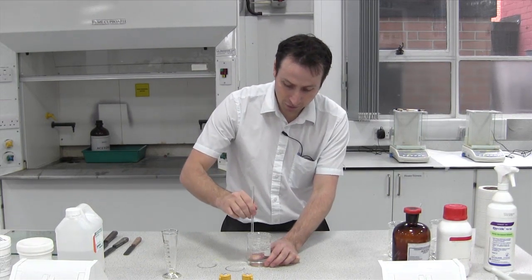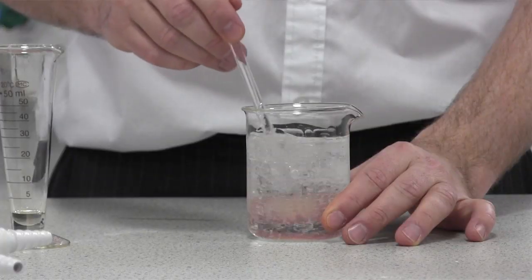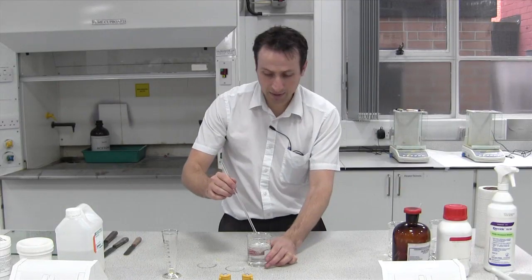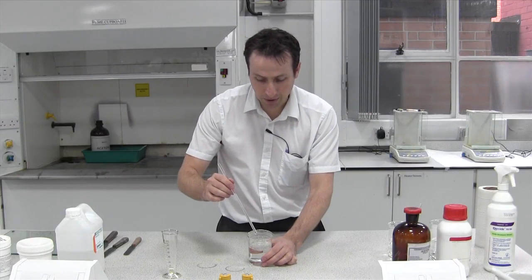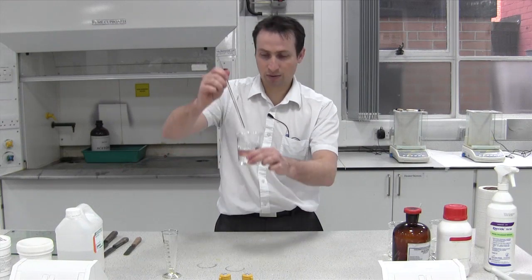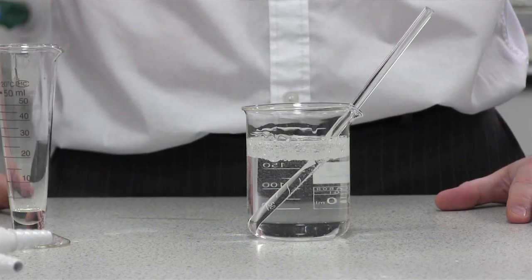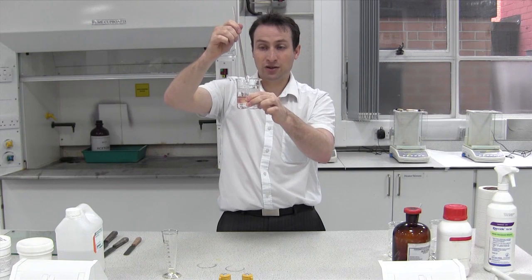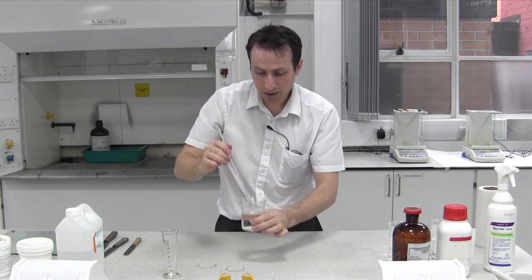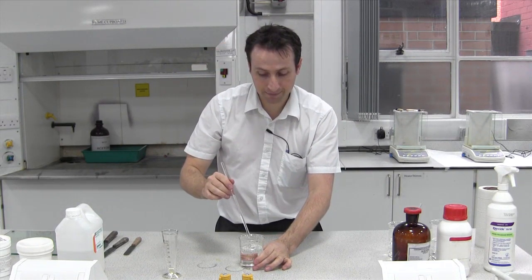If we give it a quick stir and agitate it, you can clearly see, at least on the top anyway, that there are two layers. The top layer, which is what we've added, is bubbling and slowly aggregating together.